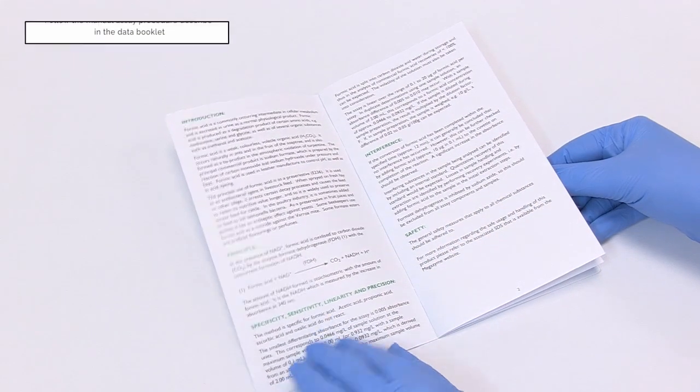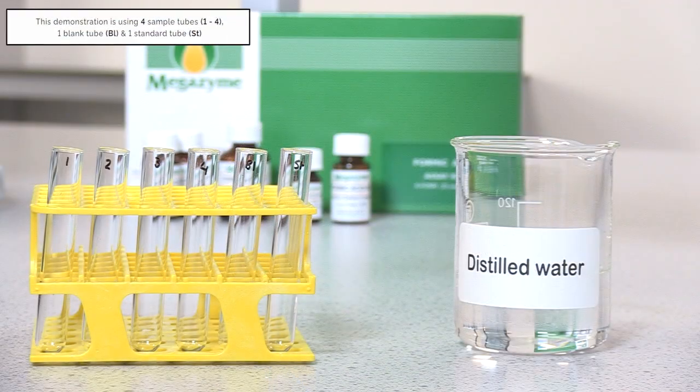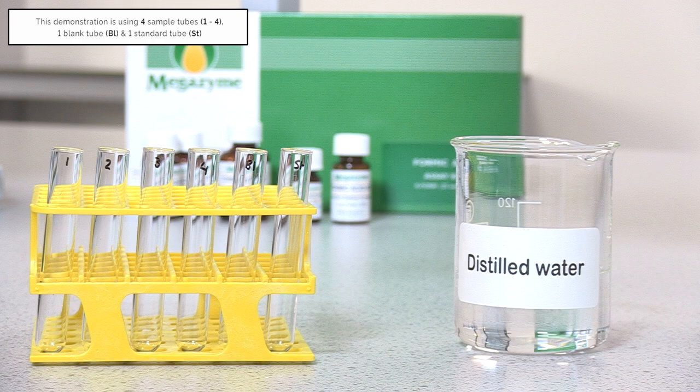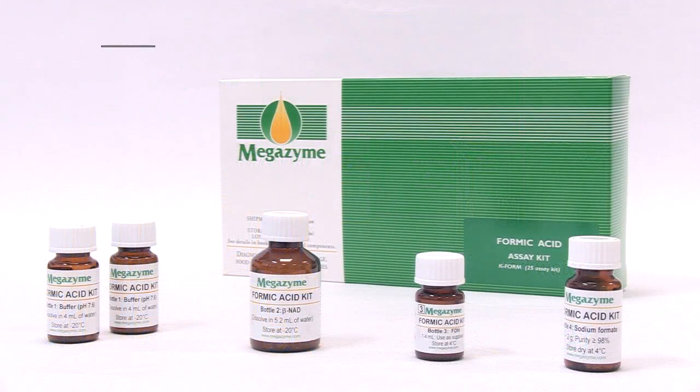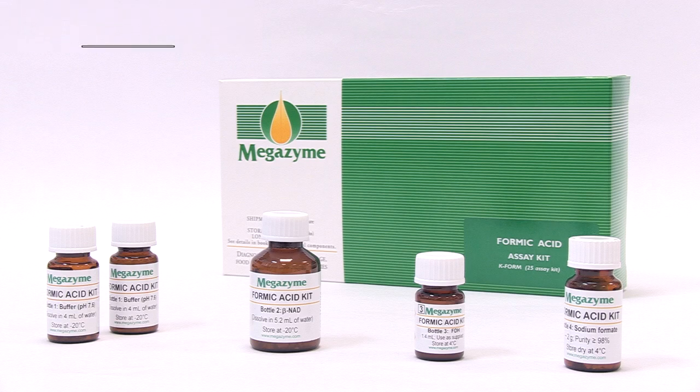Follow the manual assay procedure as described in the data booklet. This demonstration is using 4 sample tubes, one blank tube and one standard tube. A blank reaction and a standard reaction must be performed with each batch of samples.